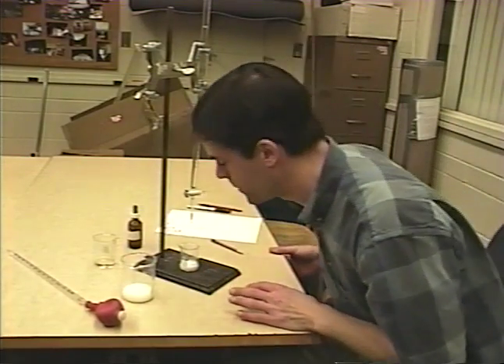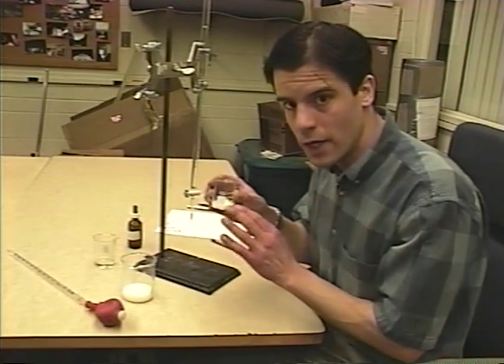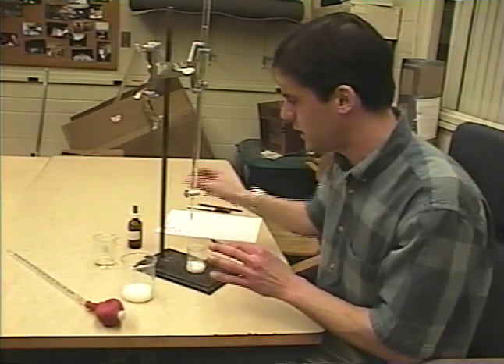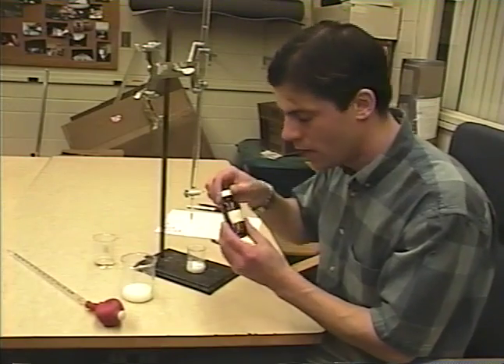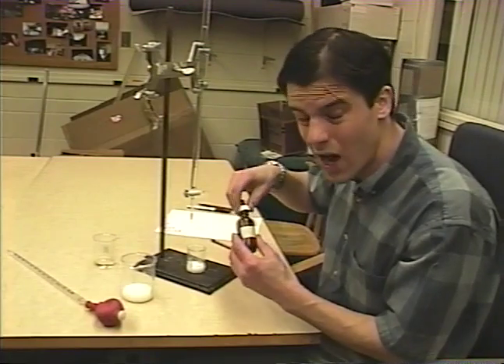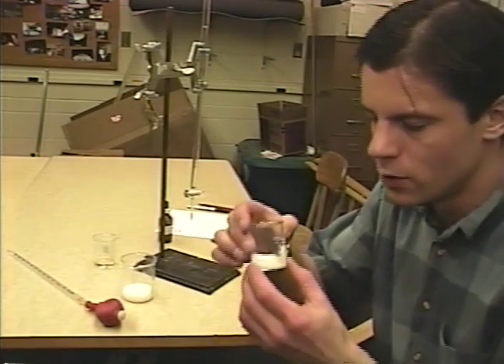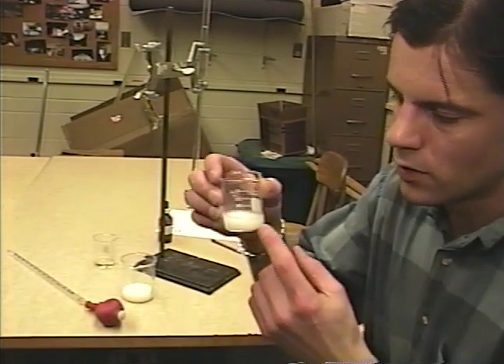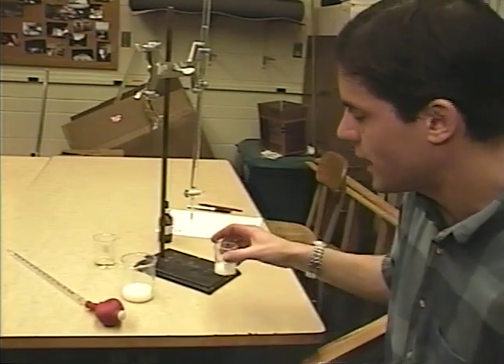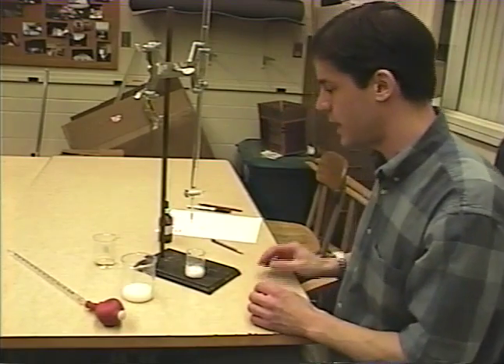I can do that pretty quickly because I'm experienced, but you may want to work a little slower the first time. Now I have my milk in the reaction beaker or flask and I'm pretty much ready to go except for the phenolphthalein. This is an indicator that's going to tell you when you've reached the endpoint. You add one, maybe two drops of phenolphthalein. It is colorless when the solution is neutral or acidic, so the milk still just looks like normal milk. When there's excess base around, the phenolphthalein turns a very bright pink, and you'll be able to see that in a second.